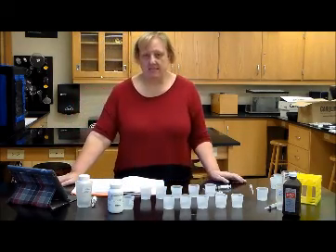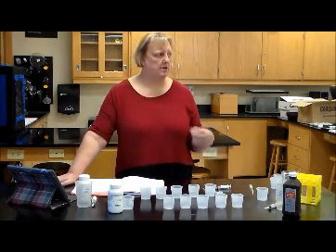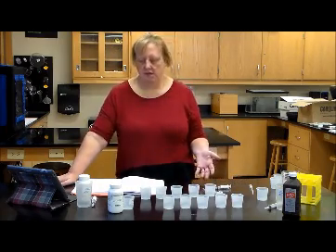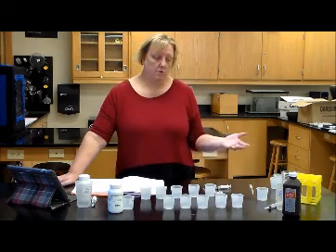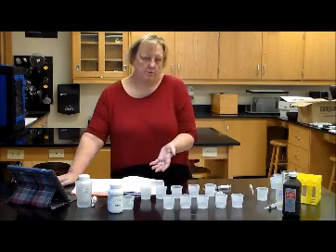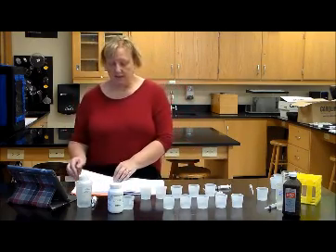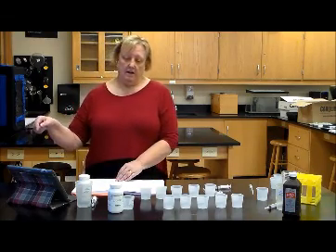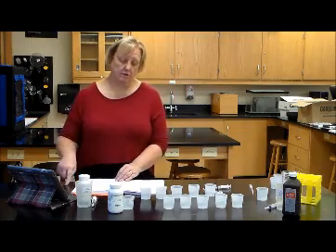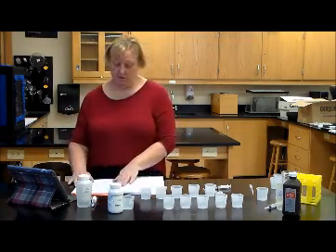Activity B is determining baseline. Baseline is your standard. You've got to know what the baseline is before you start, because otherwise you're not going to know what the standard is, and therefore you won't know what kind of reactions are taking place. So do your baseline. If you do your baseline on one day, then you may have to redo the baseline the next day if you don't go on to the next activities.